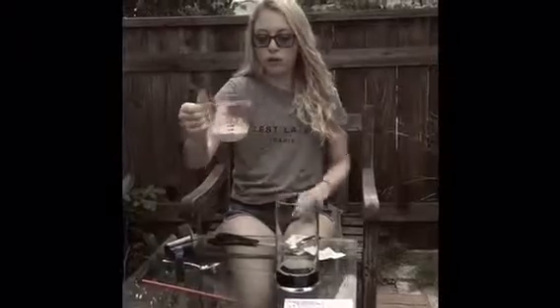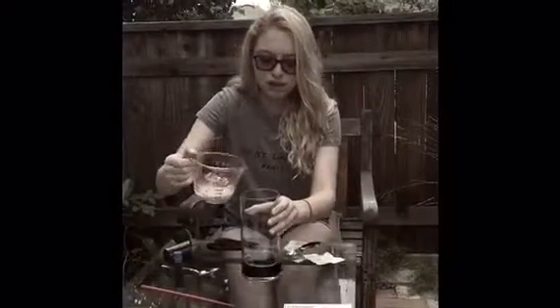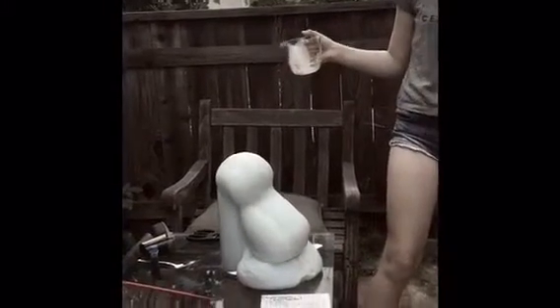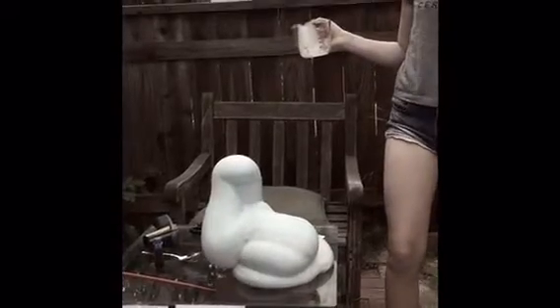So you're going to go and pour your yeast and water into your beaker. And that happened. This is an exothermic reaction. And it kind of went everywhere.